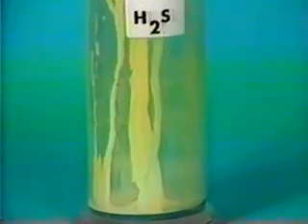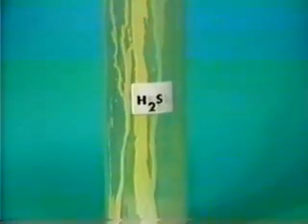And within two minutes, considerable solid yellow sulfur can be observed on the sides of the containers. This yellow sulfur is produced by the reaction of sulfur dioxide and hydrogen sulfide, a reaction which is slow unless catalyzed by a suitable catalyst, such as water.